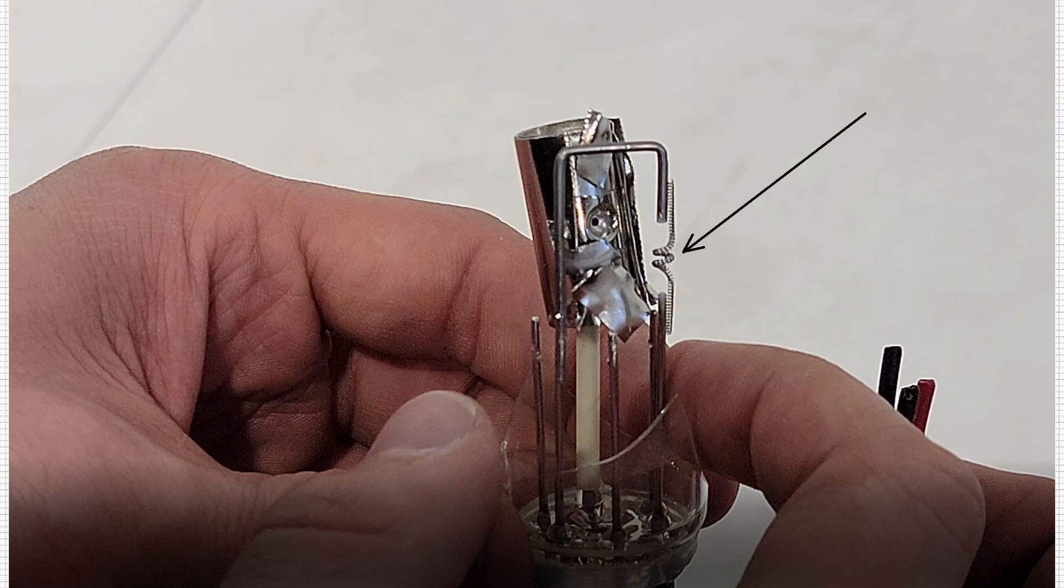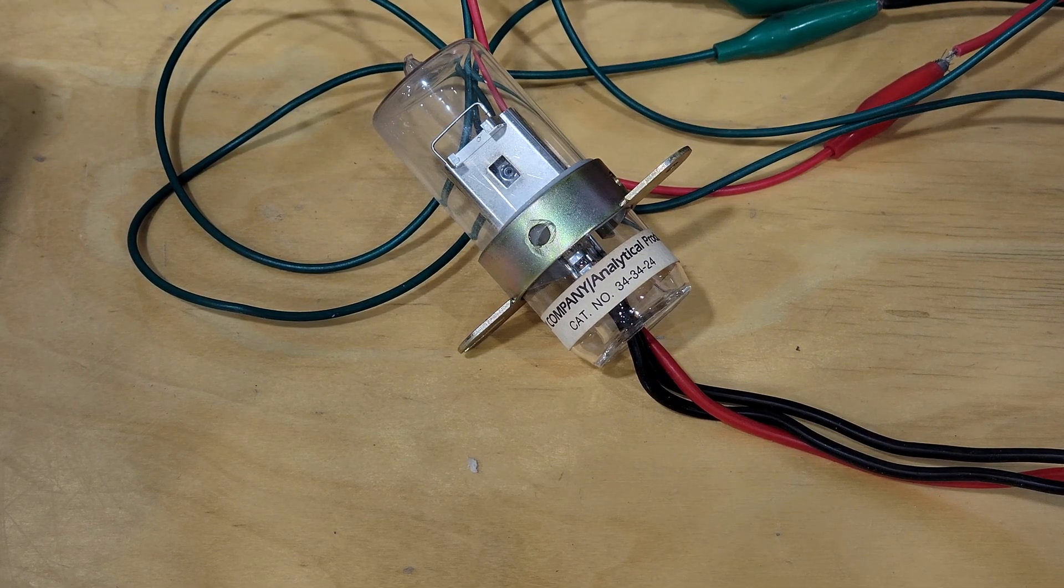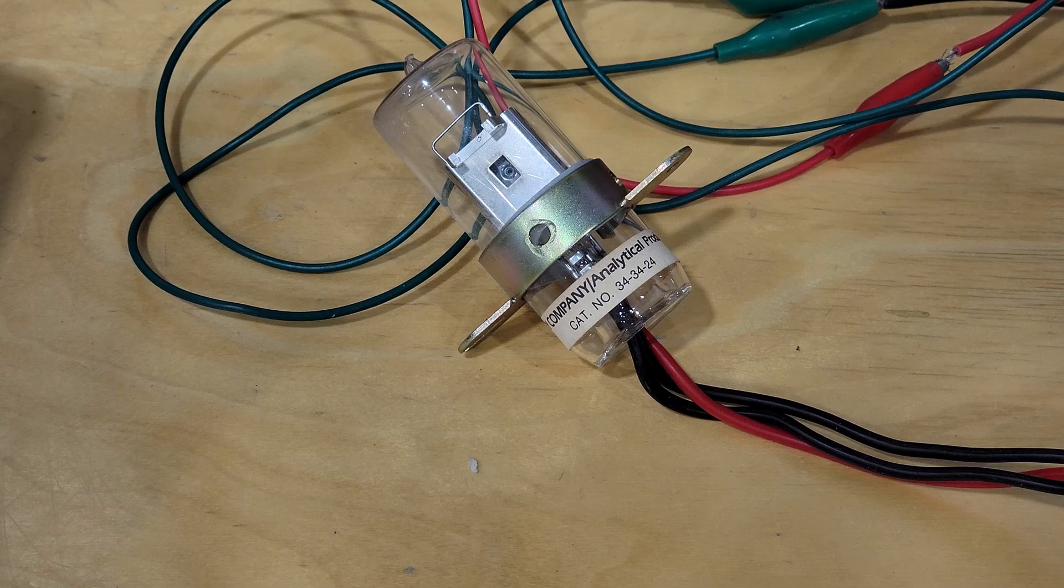The cathode is not always just one straight wire, but sometimes a resistive loop of wire that's capable of being heated by passing some current through it before ignition. After the heater has been on for some time, typically 10 or 20 seconds, a firing voltage starts the arc lamp.